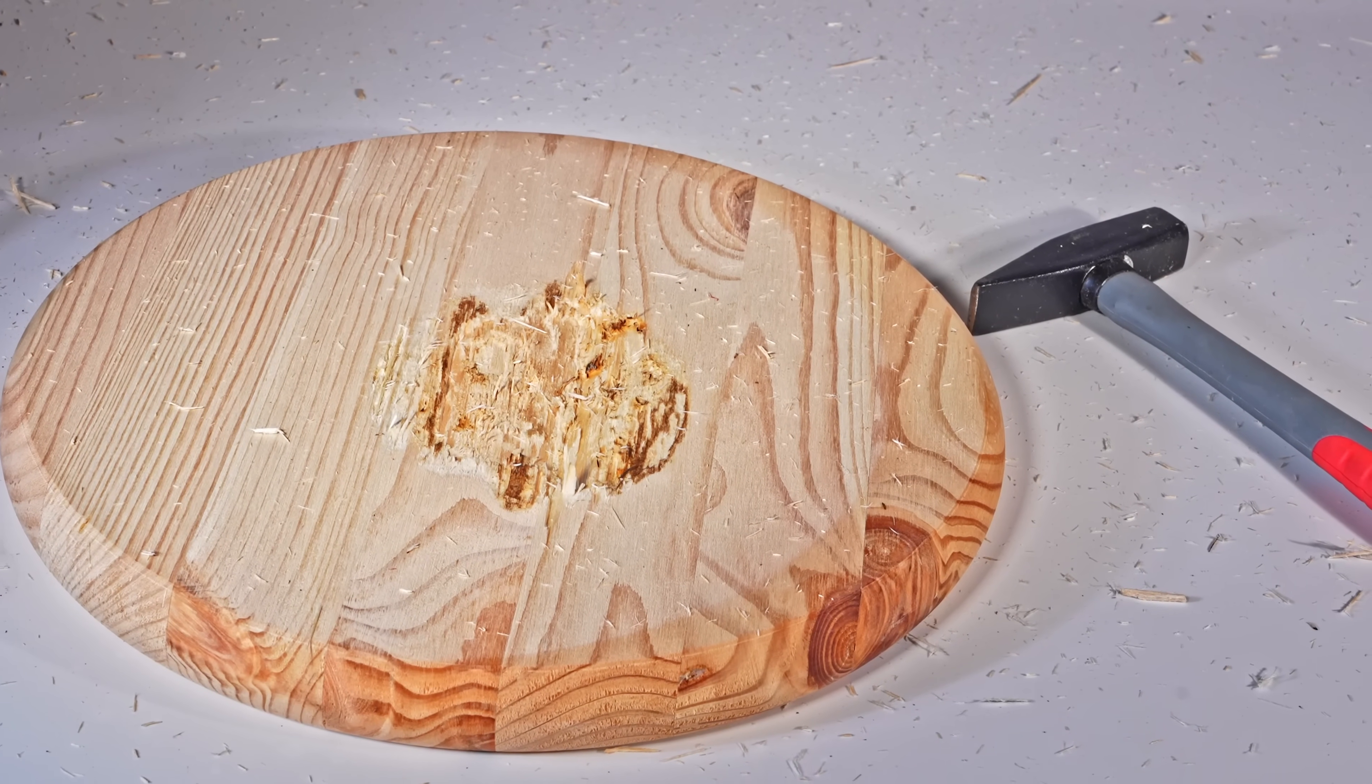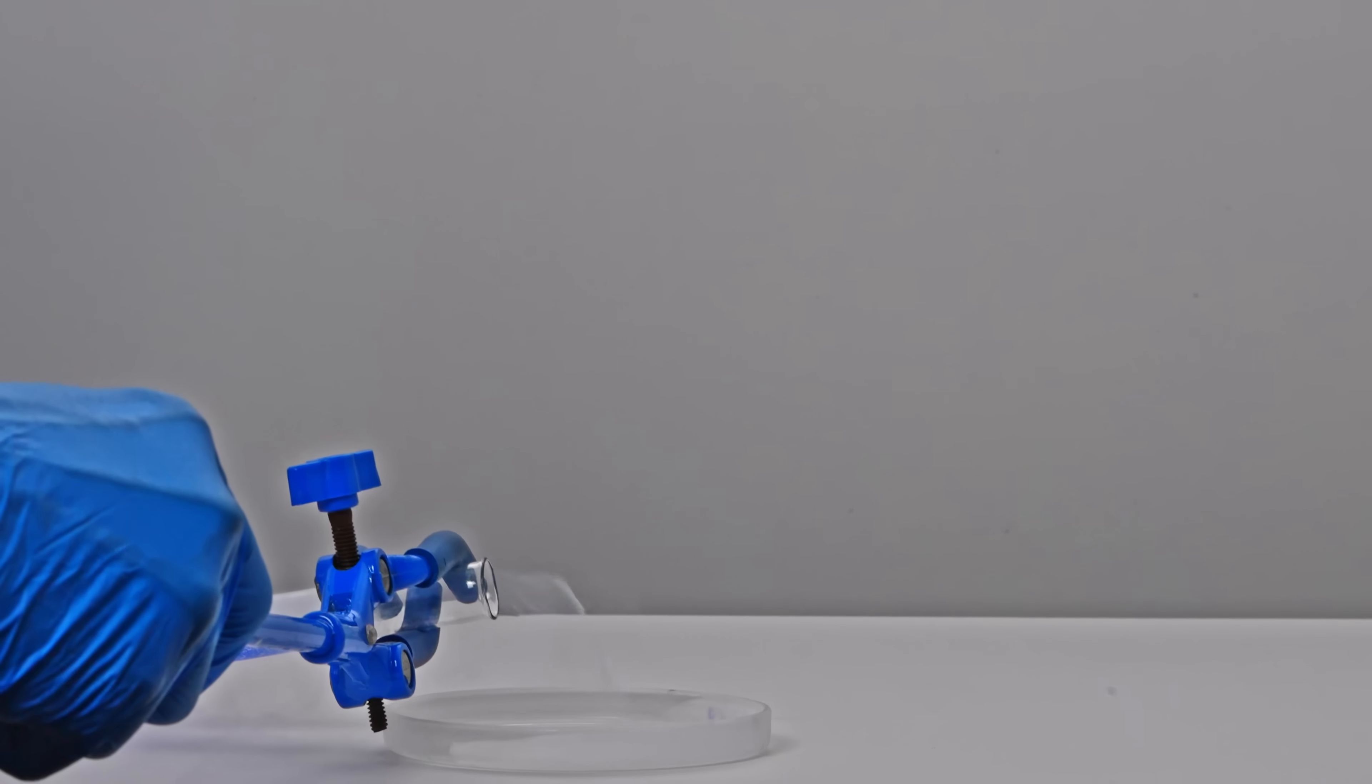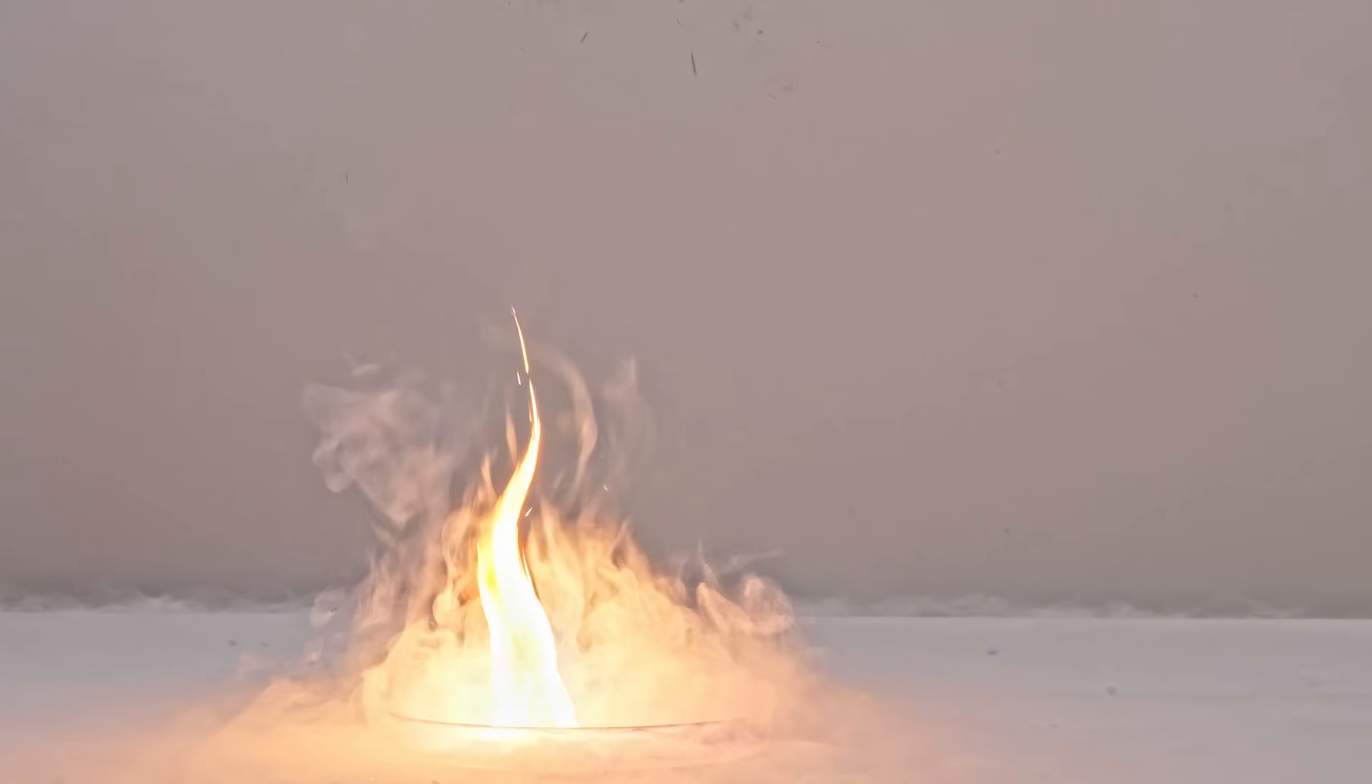Cotton wool soaked in turpentine also ignites upon contact with ozonated oxygen. In slow motion, you can see ignition occurring even before direct contact with the liquid surface.